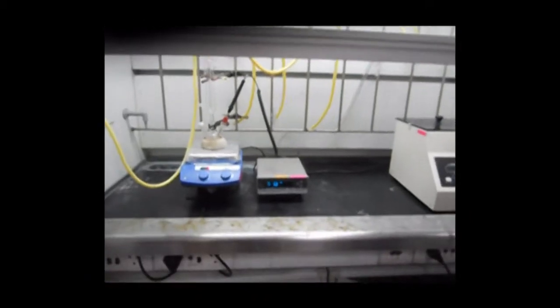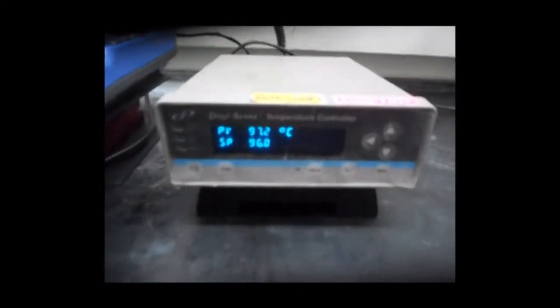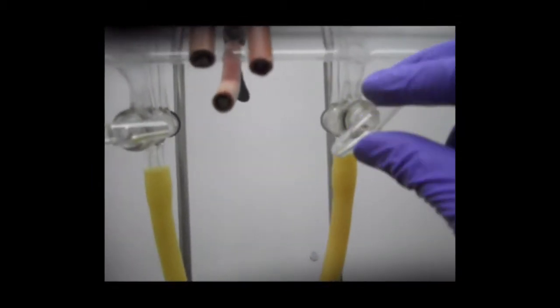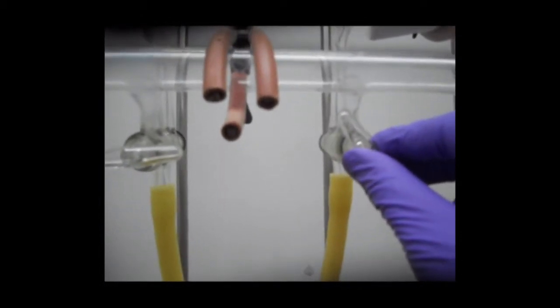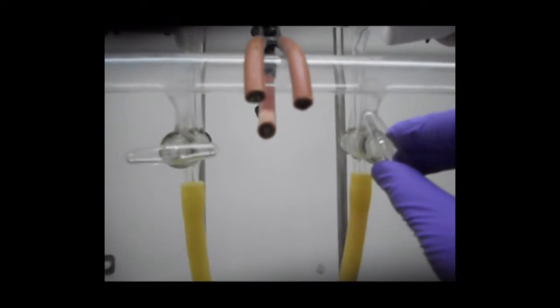See, the temperature is increasing. Now the temperature is 90 degrees centigrade. What we will do now is degas it. This will reduce even trace amounts of oxygen and water content dissolved in the reagents. We will apply vacuum for 5 minutes and nitrogen gas for 2 minutes alternately, and we will do this 3 to 4 times.